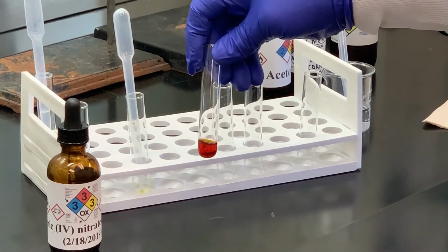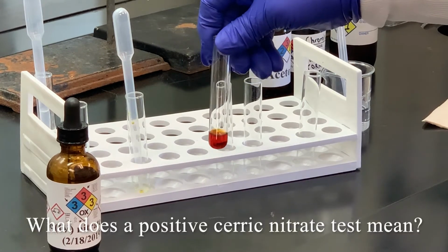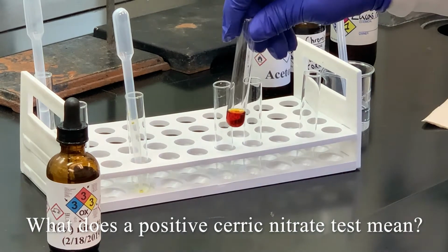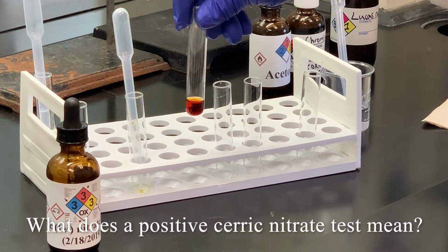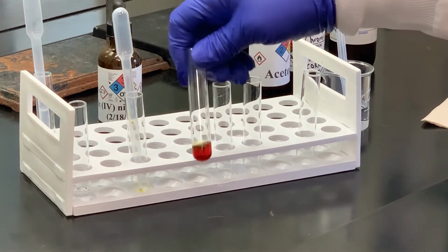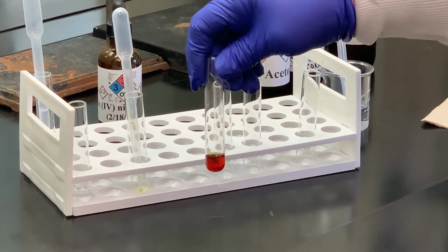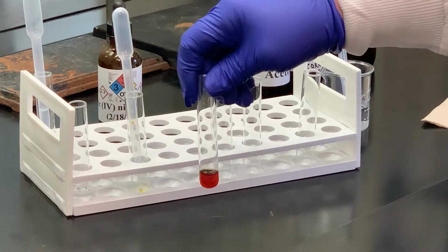And if you notice, it went from yellow to this red color, so that's a positive test. And what does the ceric nitrate reagent identify? It's positive because there was a color change. So make sure you make note of that. So since we have a red color, that means, and remember the ceric nitrate test is positive for alcohols, so now what we're looking at is an alcohol functional group.